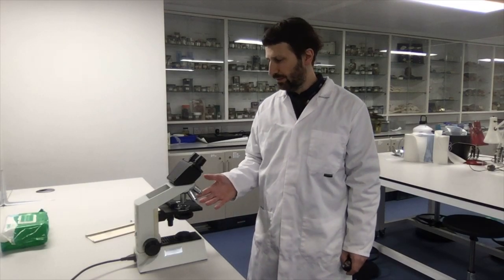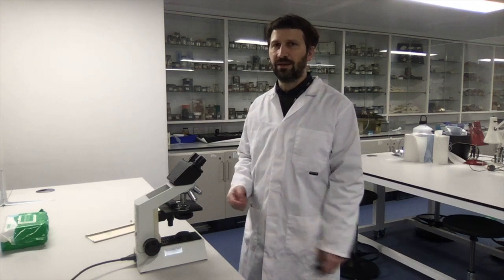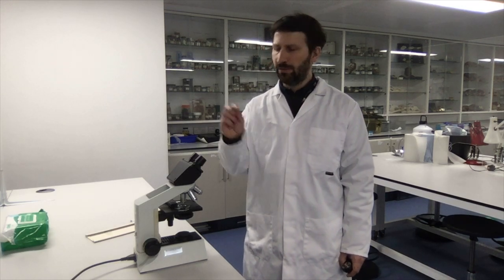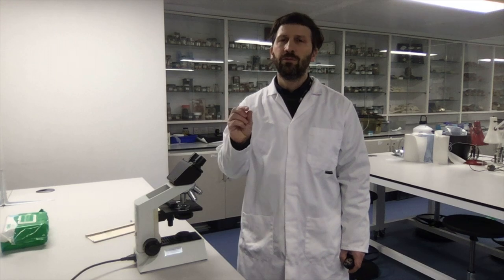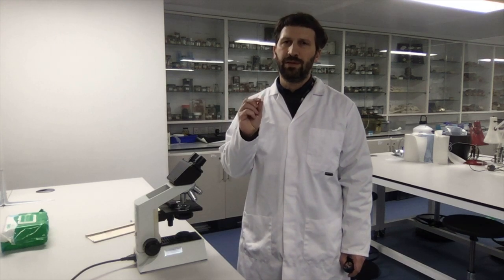Today we learn to use the compound microscope, which is this object here in front of me. This is an object that is particularly useful if you want to observe small objects ranging in size from about 1 mm to 0.2 micrometers.